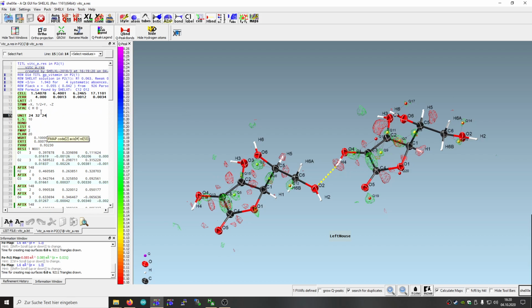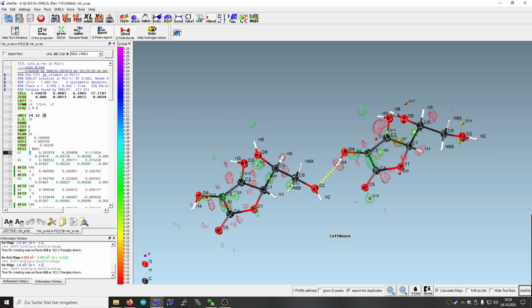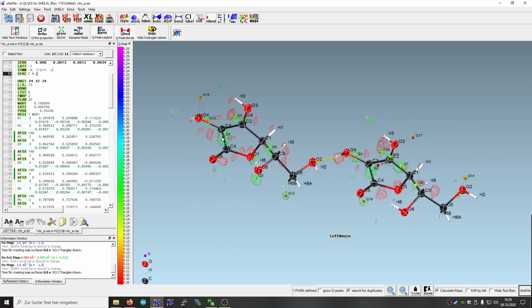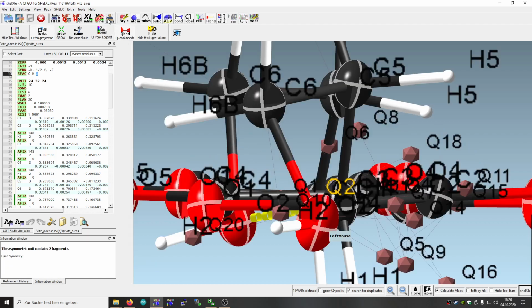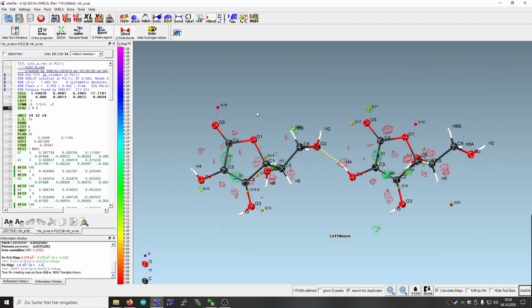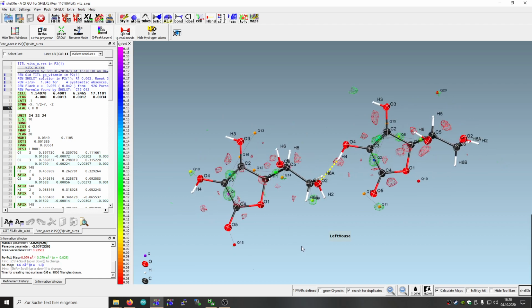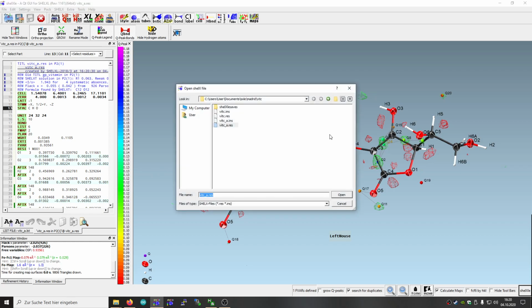at the end of the list, but sometimes we have that within the list, and changing the list would require that you change this number here, which refers to the position here in the list, everywhere, and this is done automatically by this functionality. And to finalize, we just refine the weighting scheme, and so we are done with that structure. So then we just move on to another structure and try if we could solve that as well.